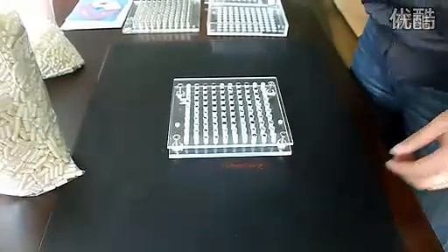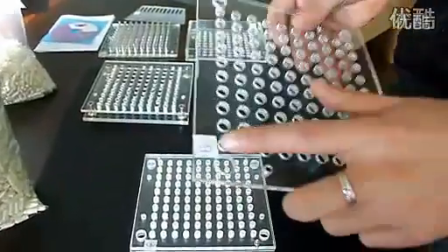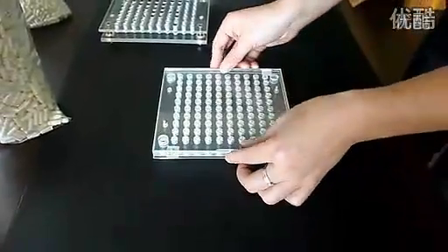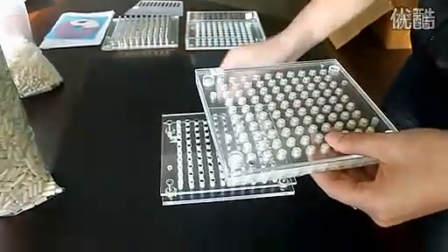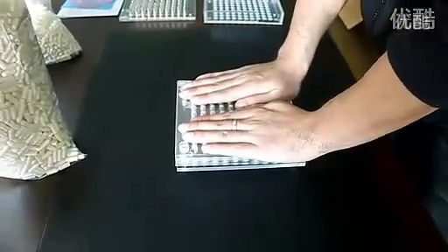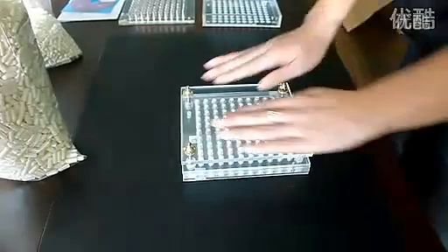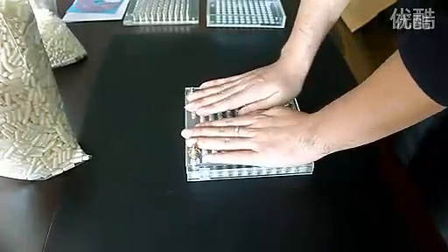Put the tamping tool and spreader to one side. Take the filled cap sheet and place the middle sheet on top using the stainless steel pegs protruding upwards. Turn the cap sheet and middle sheet over and fix to the bottom sheet. Now place both hands on the top and push downwards once with equal pressure. Turn the whole set over, place both hands on top, and push downwards to lock the capsules.